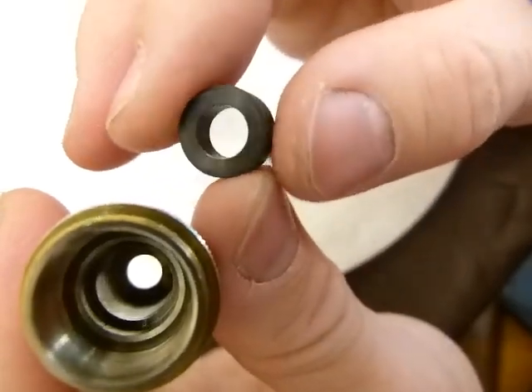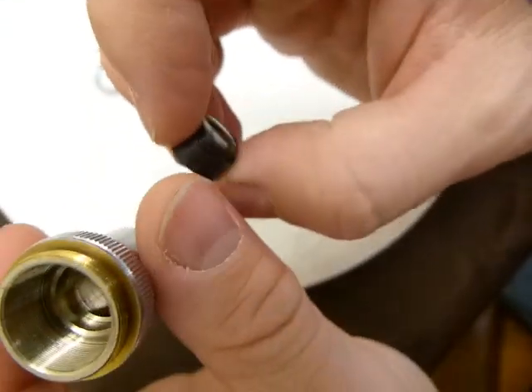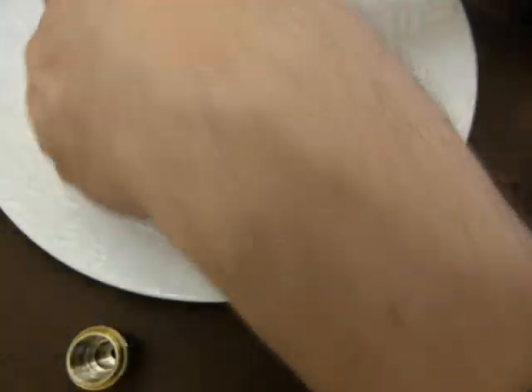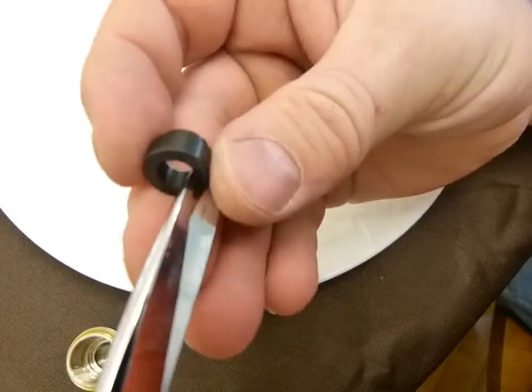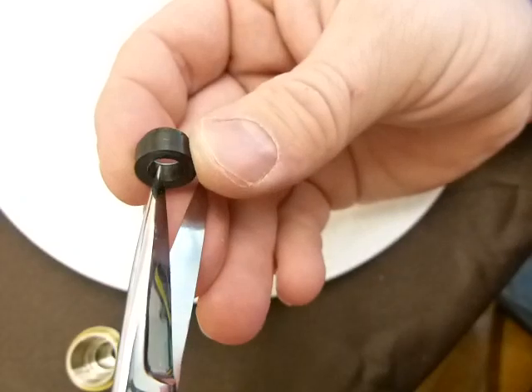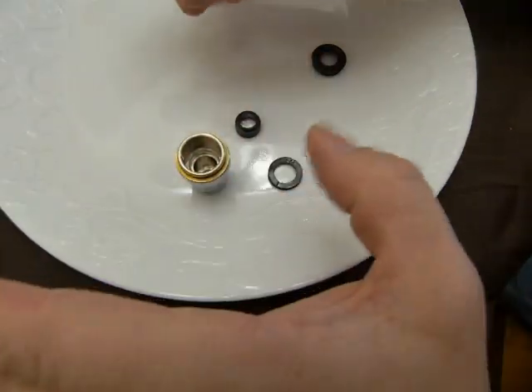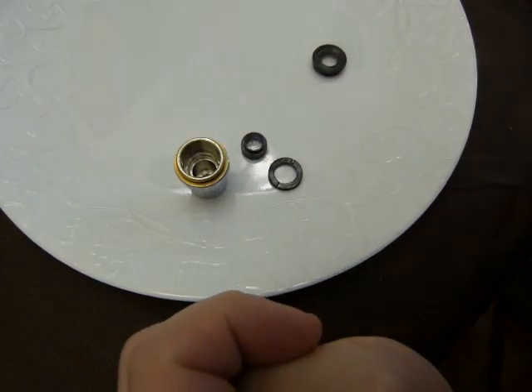From the underside, you have a better chance of cleaning it when it's in your hand like this. That surface is easy, not the one on the underside, because this is hollow. I'm not trying to scratch it — I'm just showing you, this is a hollow ring here, so the lens is not too thick. You can see I can place the scissors in there. That's how it comes apart; reverse order, it goes back together. That's all there is to it — wash it clean, jolly good.